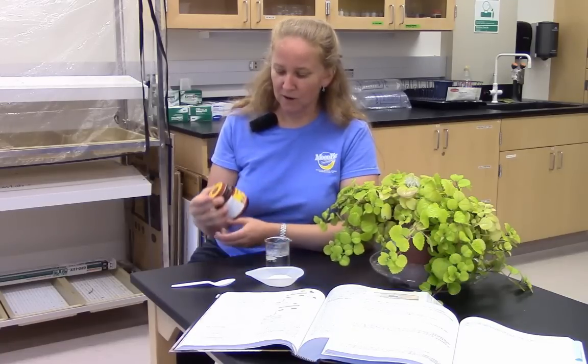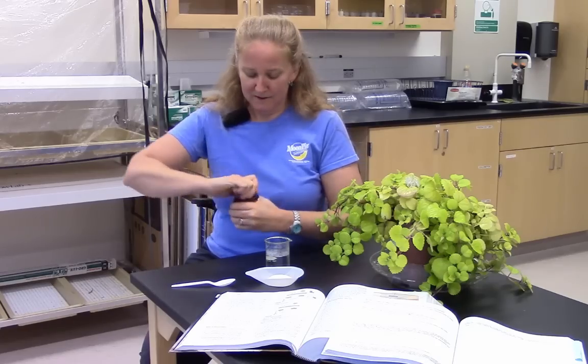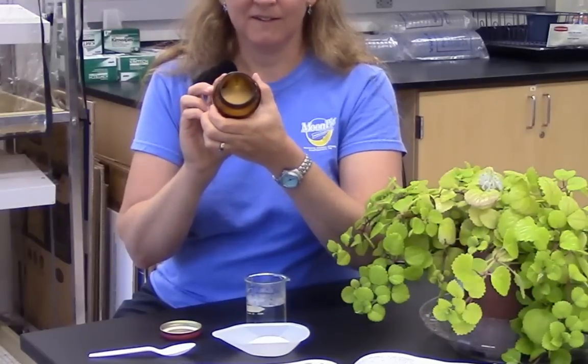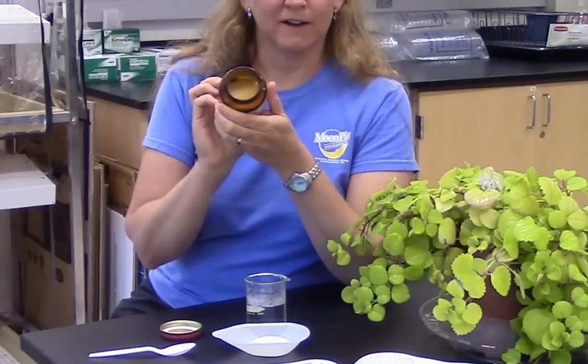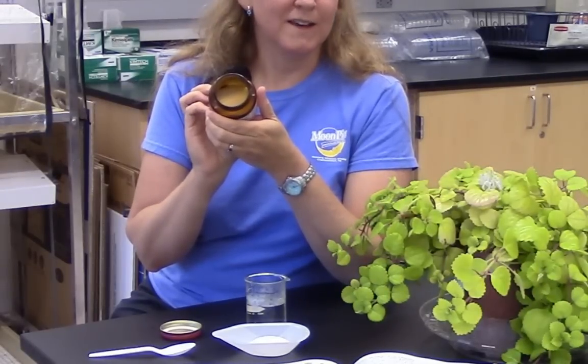In front of me is the living organism you'll be working with in lab when you study cellular respiration and fermentation. It's not this plant, which is our focus for the photosynthesis lab, but rather the organism in this jar. You may have purchased this organism in the supermarket in a foil packet or in a jar like this if you do a lot of baking. This is Fleischmann's active dry yeast. Inside, there are a whole bunch of tiny brown grains — those are yeast in a resting state.